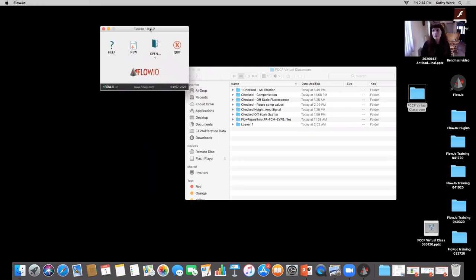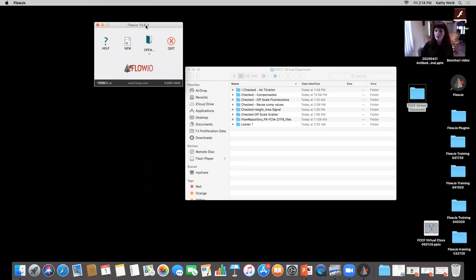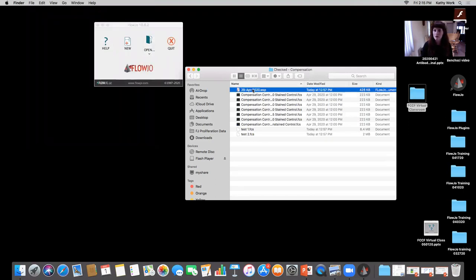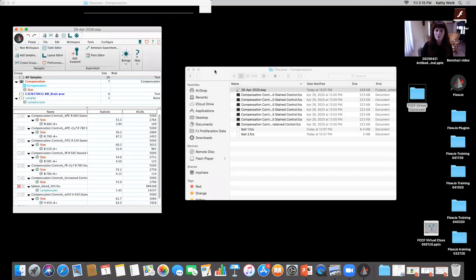And then, with the time that we have, I tend to go over a little bit, I'm going to show one more example with compensation data and what can happen without the appropriate controls, and tie it into that last comment about the need for the single colors to be as bright or brighter. So I'm going to go in and do new, open up this compensation. And as opposed to creating a whole new workspace, let me just work with a workspace that I'd already had for that one to save some time in case you guys want to go over any specifics of compensation.